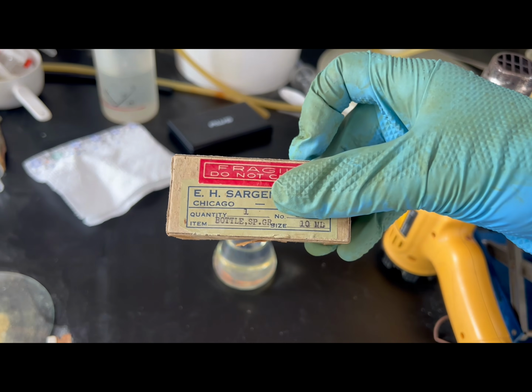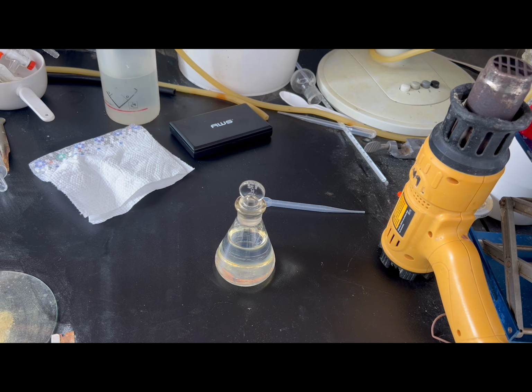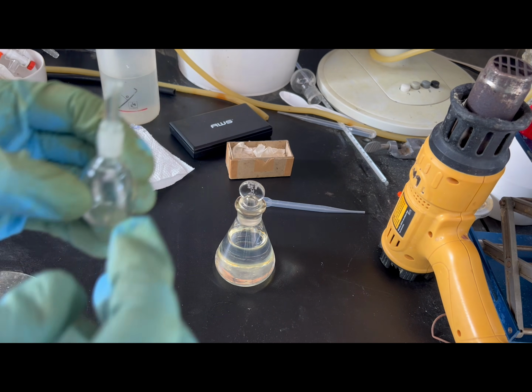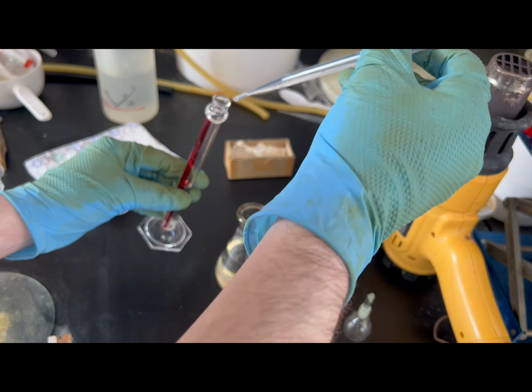The boiling point was in a 20-degree range, about 10 above and 10 below the reported boiling point of 197.2 degrees. I wasn't convinced it was absolutely pure due to the wide boiling point range, so I decided to break out an old piece of glassware I haven't had the chance to use.